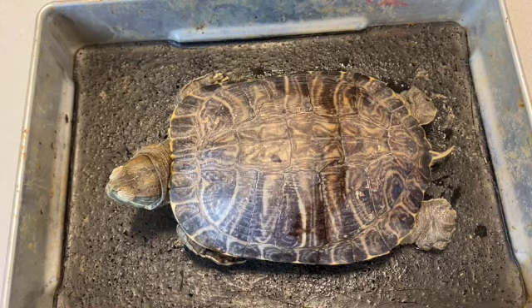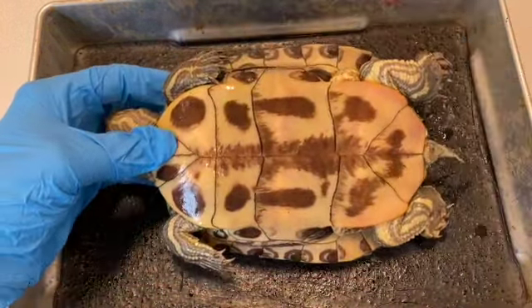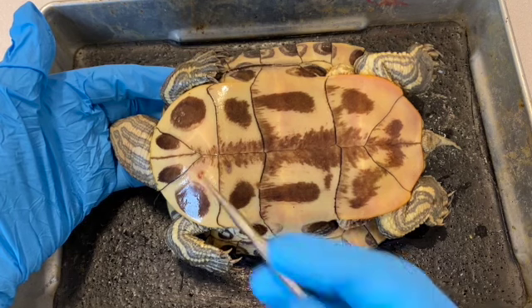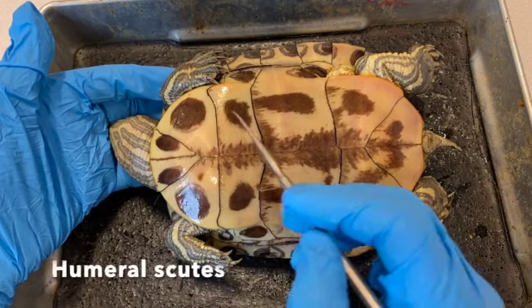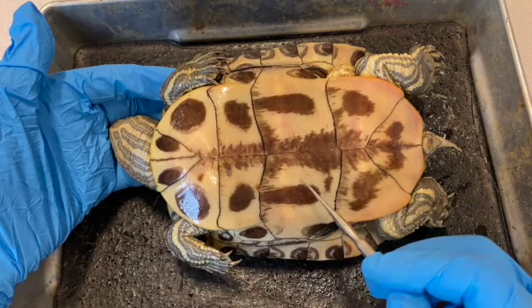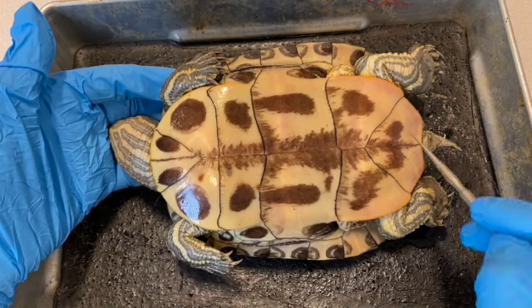Let's look at the scutes of the plastron. So the plastron of this animal, again going anterior to posterior, these are gular scutes, then humeral scutes, these are pectoral scutes, abdominal scutes, femoral scutes, and anal scutes.